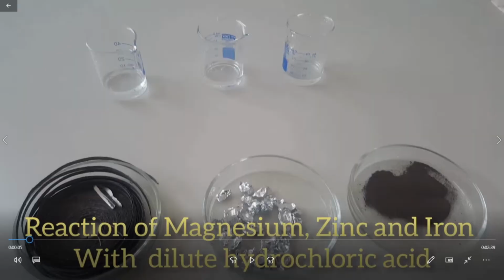Welcome to the video lecture series of metals and nonmetals. Today we are going to compare the reactivity of magnesium, zinc and iron with dilute hydrochloric acid. So this is a reaction between metals and acid. But we are going to compare the reactivity of magnesium, zinc and iron.